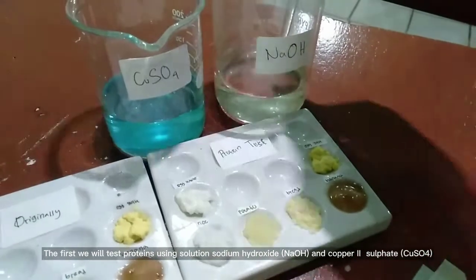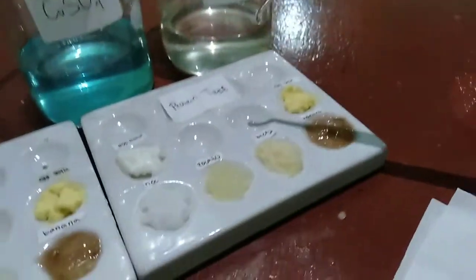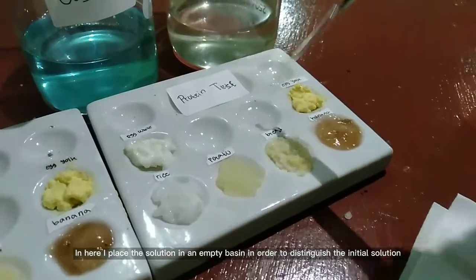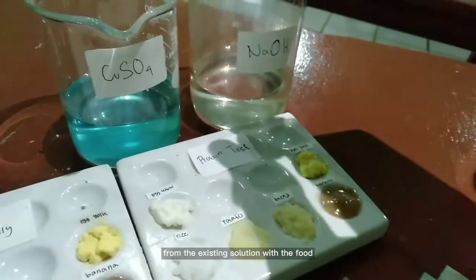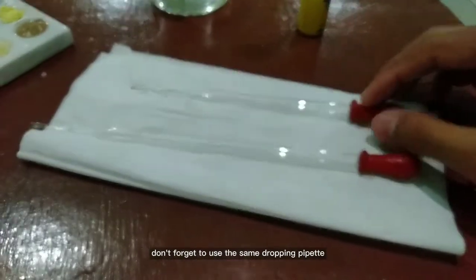The first, we will test protein using solution sodium hydroxide and copper 2 sulfate. In here, I place the solution in an empty basin in order to distinguish the initial solution from the existing solution with the food. Don't forget to use the same dropping pipette.